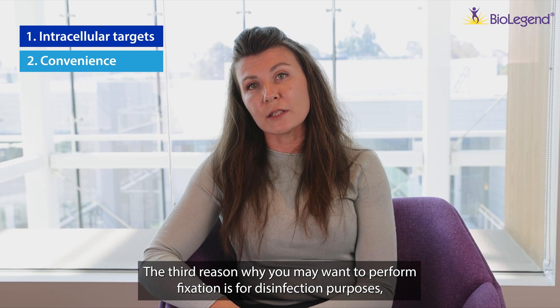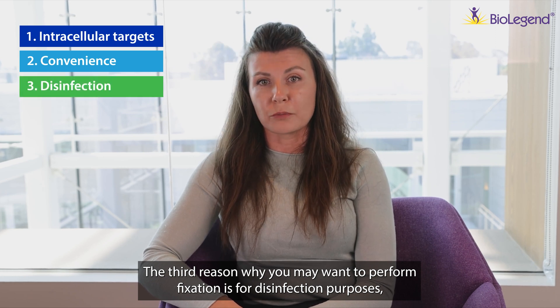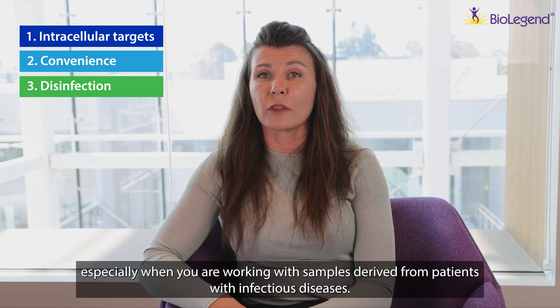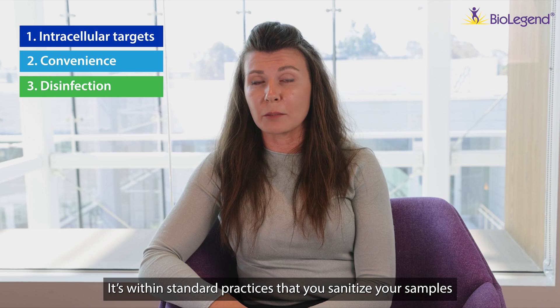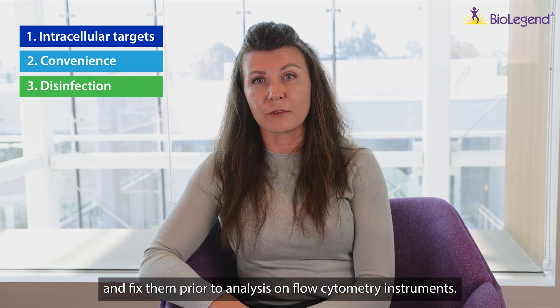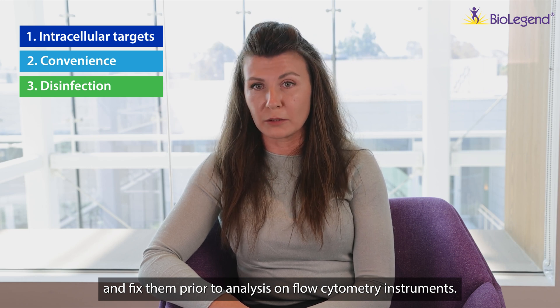The third reason why you may want to perform fixation is for disinfection purposes, especially when you're working with samples derived from patients with infectious diseases. It is standard practice to sanitize your samples and fix them prior to analysis on the flow cytometry instrument.